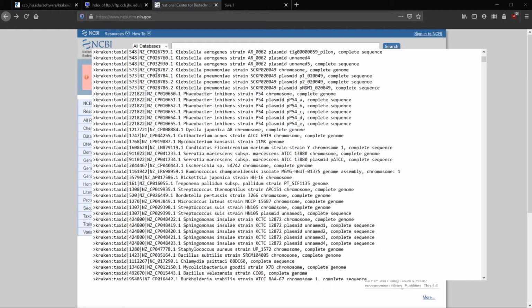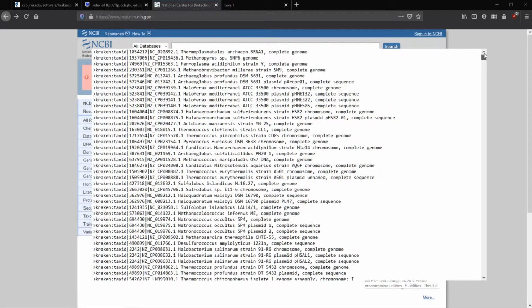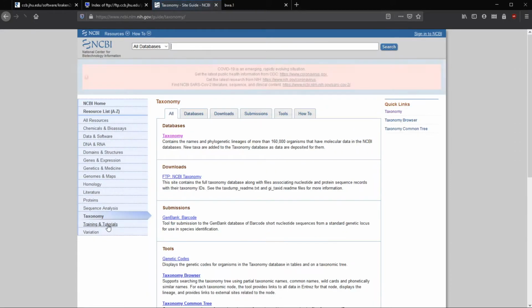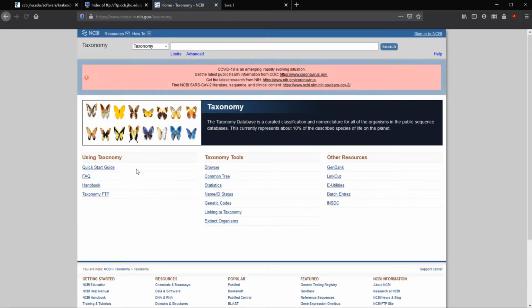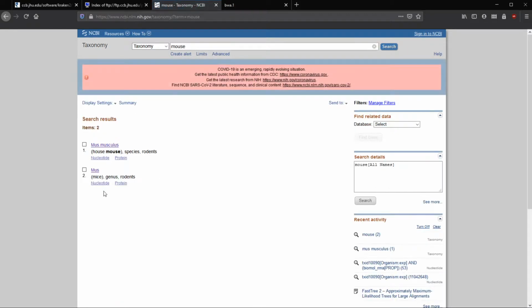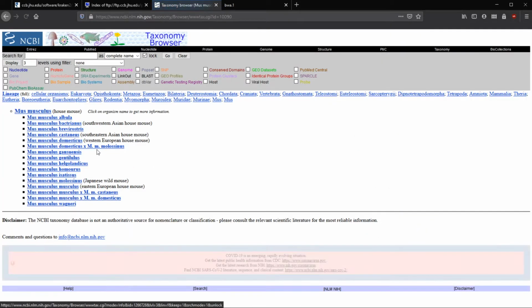So let's go back up to the top. Okay, and let's go to NCBI, so that we can hit two birds with one stone in this case. First, we'll go to taxonomy, because we want to search for taxonomy. We'll select taxonomy again. And then up here, what we want to look for is mouse. So we can type musculus, the scientific name for mouse. And then this shows up on the right. I think alternatively, we can just type mouse, but multiple will show up. So let's select Mus musculus.